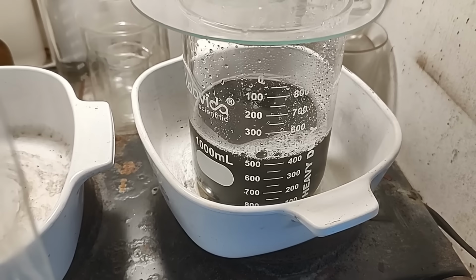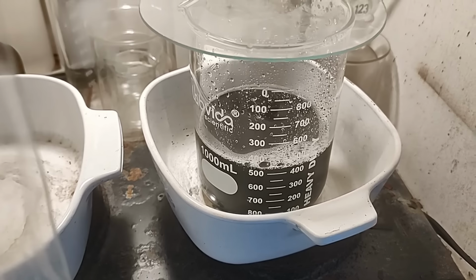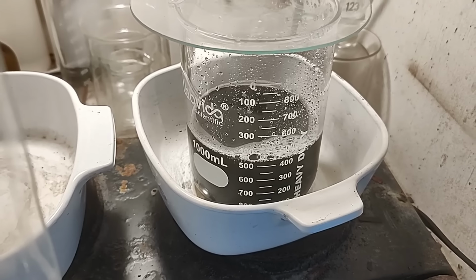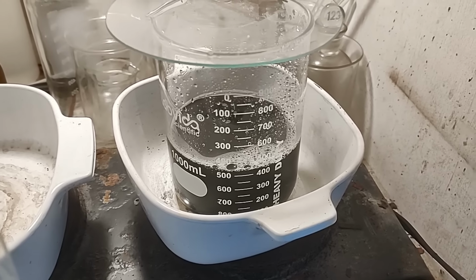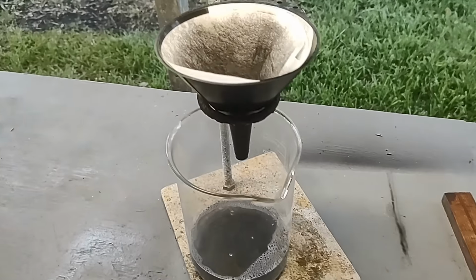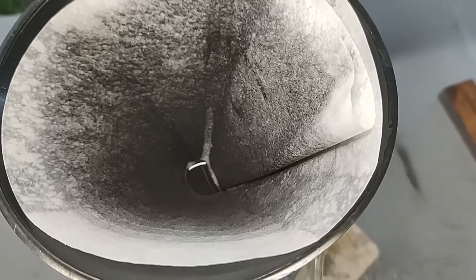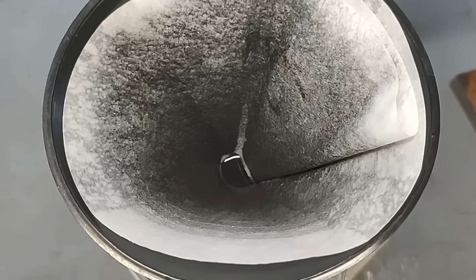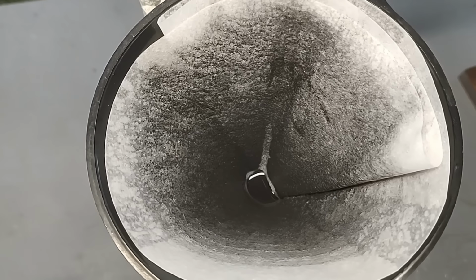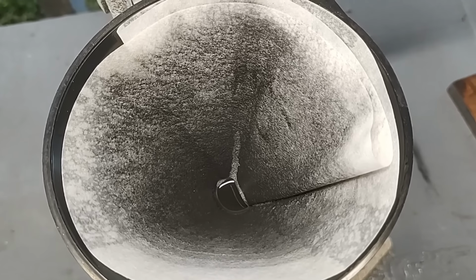But this is heating up. We'll give it a good boil, and hopefully it'll be like clean gold and consolidate nicely. We'll see. I don't know. Maybe, maybe not. Anyway, let me show you something else. So I decanted the water off through this filter, and you can see there's a lot of fine palladium that got caught in this filter. Now this looks like a lot of palladium, but it's really not. I'm sure there's not enough here to even move my scale, probably by 1/100 of a gram. It's just super fine stuff.